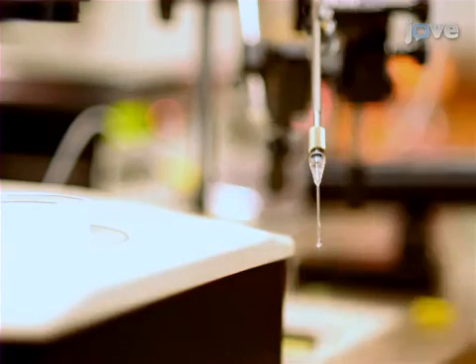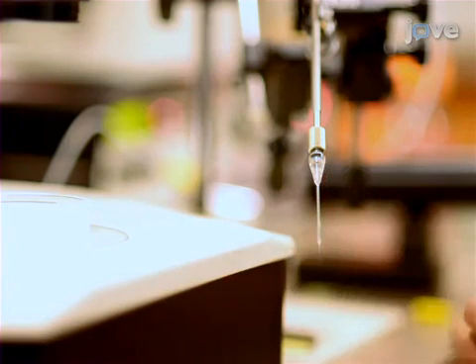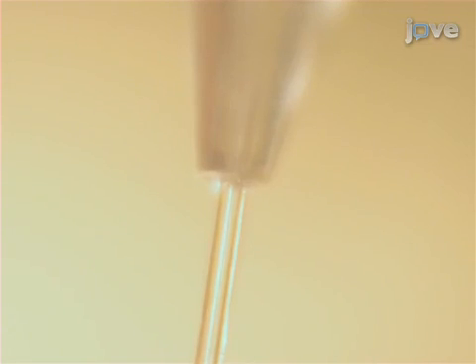Carefully break the tip of the needle. For uniform size, measure with a micrometer or compare to a reference needle. Fill the needle with oil using the oil injector to push oil down the length.